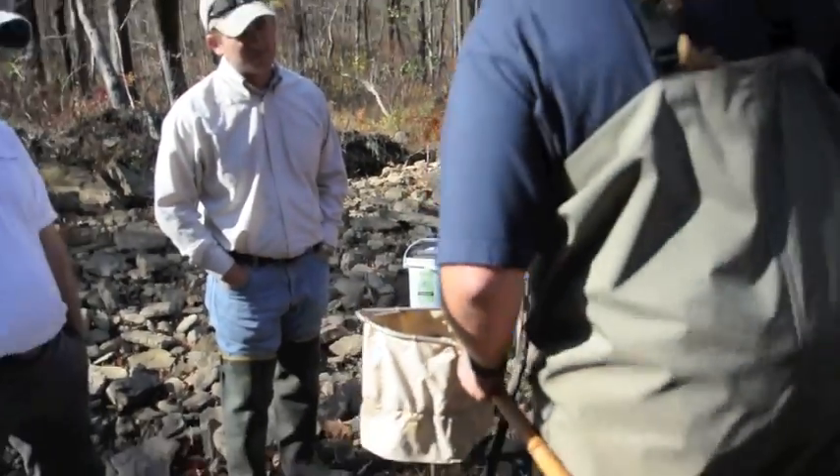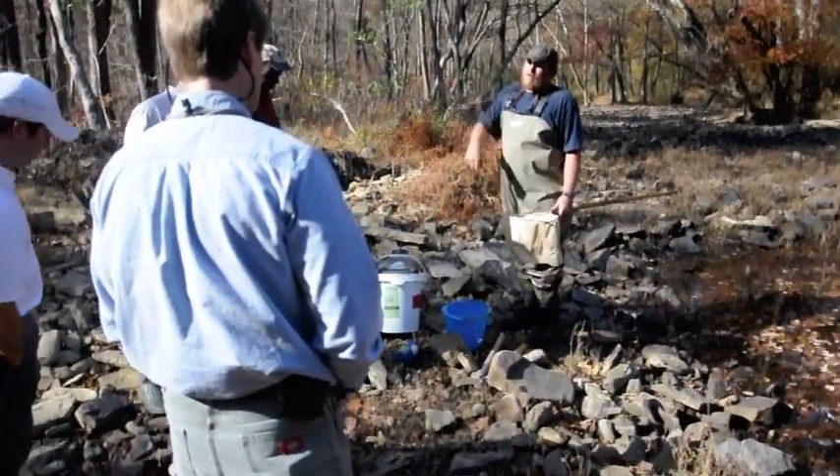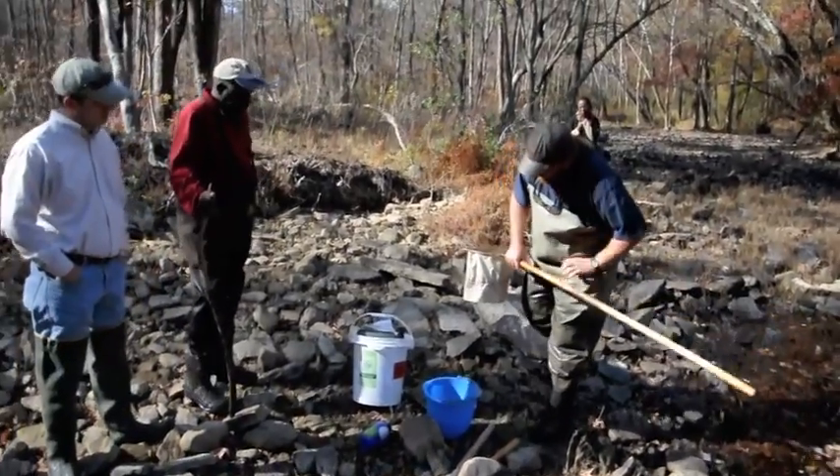So we'll see. Usually I would just take this whole thing, put it in a container like that and pour alcohol on it and sort it back at the lab. But we'll see if we can find anything.